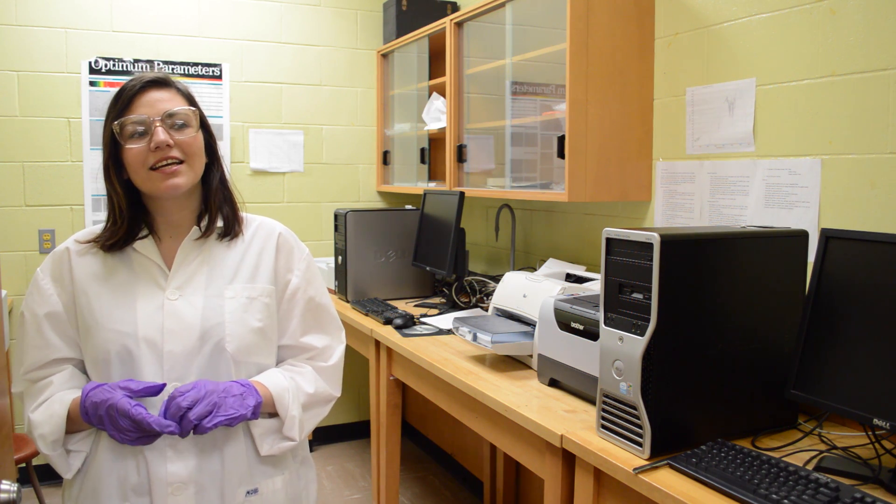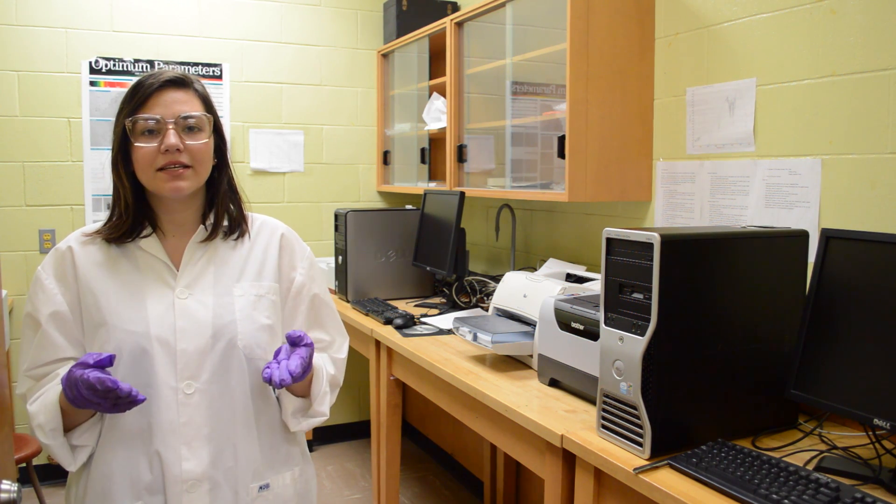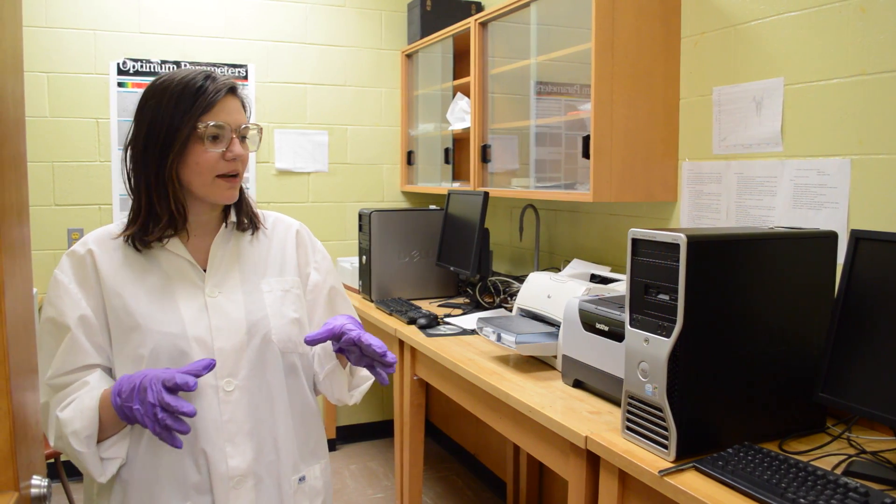This is a general introduction to IR. We use IR as a technique to identify what your compound is by looking at different functional groups that show up on the spectra.